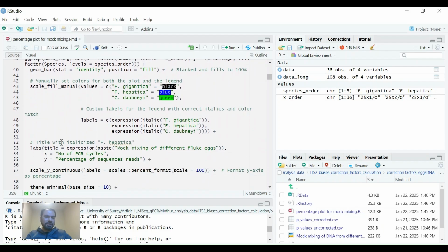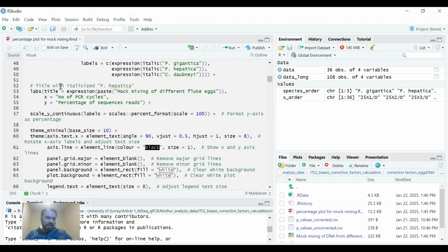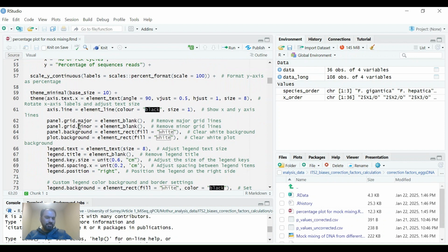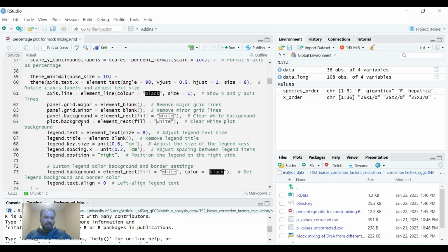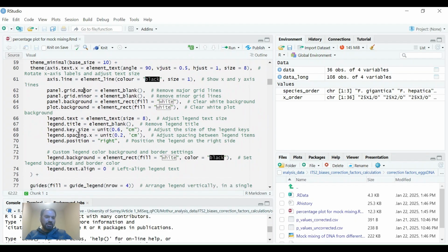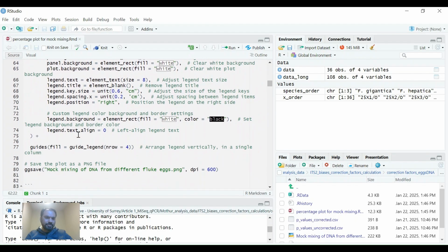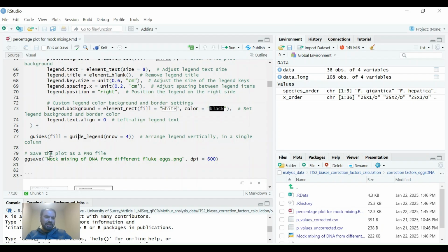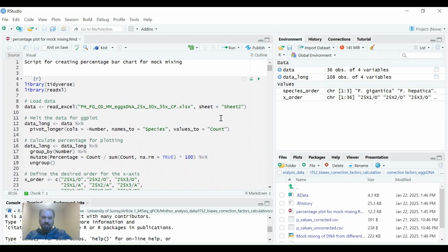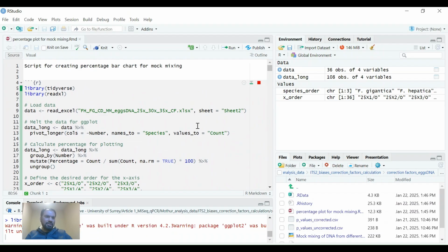Then we will use ggplot options to generate its percentage chart. And further, if we go down, we give a title to the plot, a proper title, and then x-axis and y-axis labeling, and then we have given how we can make its grid lines and background and other things using themes. Different types of themes are given, and finally the plot will be generated and saved at 600 dpi in PNG, and we can just run it here, go up and just give a run.